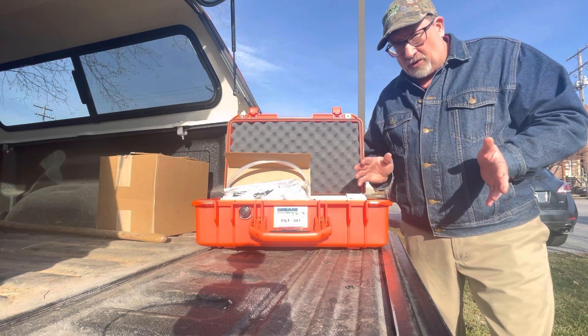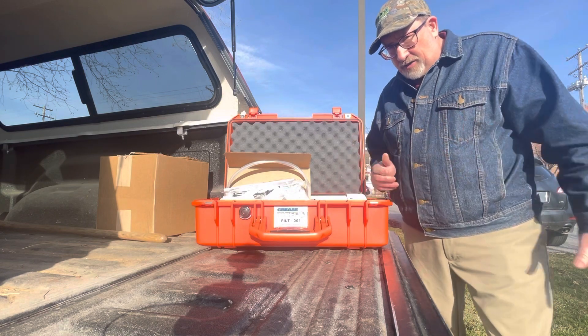So this is the setup of the kit where we wanted to start, and then I'll take you into the next steps as well.